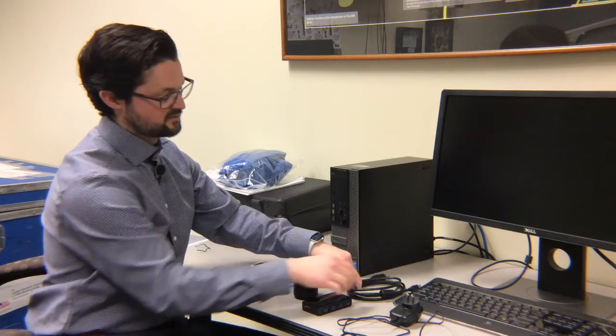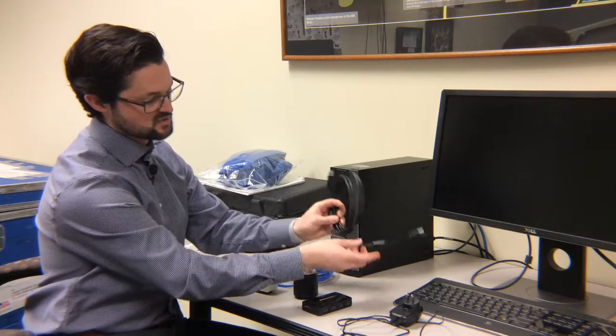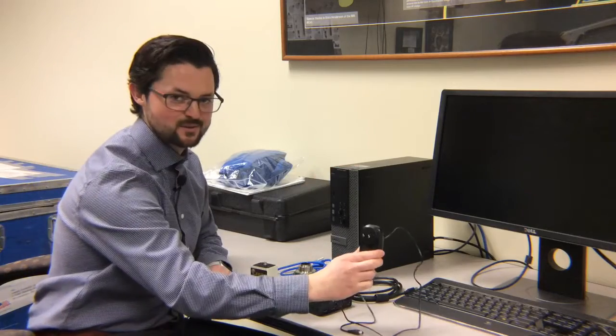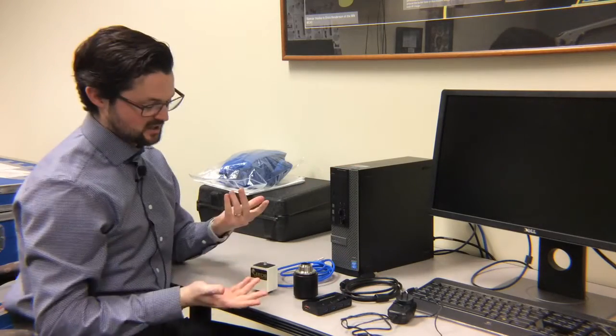And then of course you'll have the cable that runs from the hub to your computer, and you've got your power supply for that hub. So how do you assemble it?